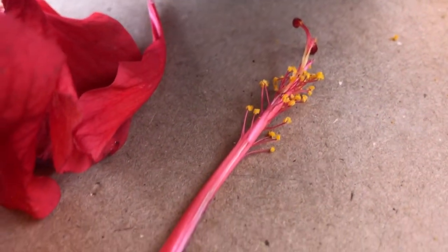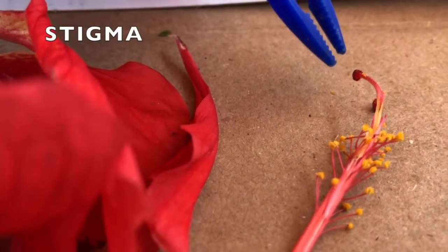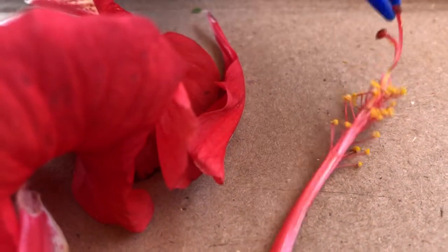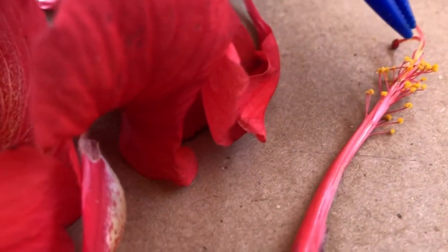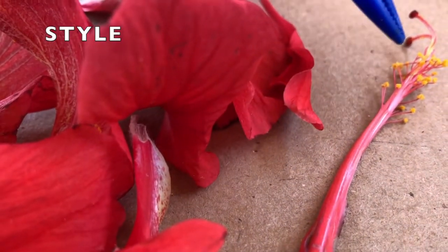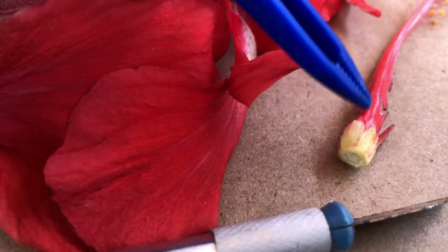If we're looking at the stigma, it's going to be these red parts out here. It's kind of hard doing this with the camera and the tweezers in my hand. So this would be the stigma here. The style would be this whole body here. And then it takes you down to the ovary, which is this region in here.